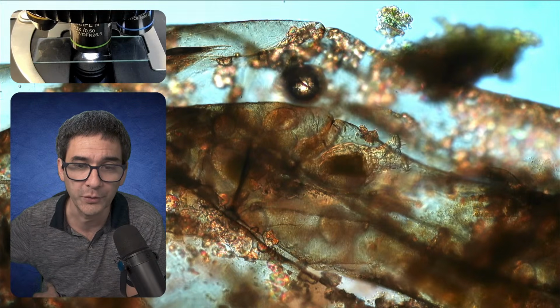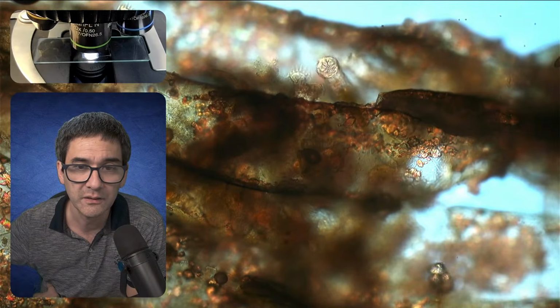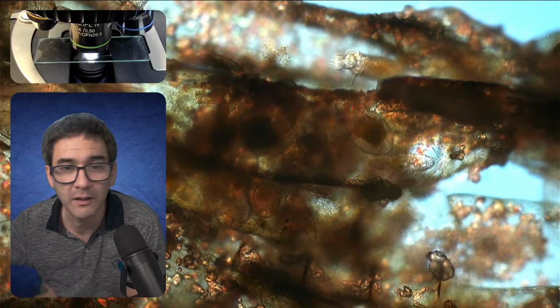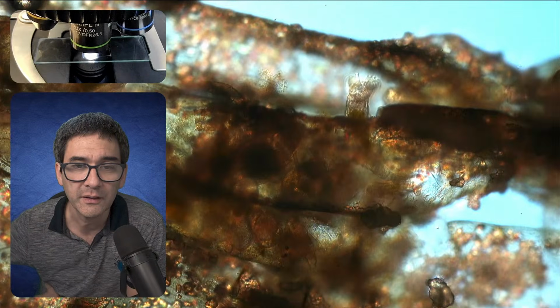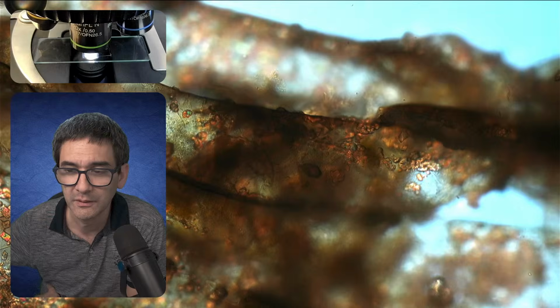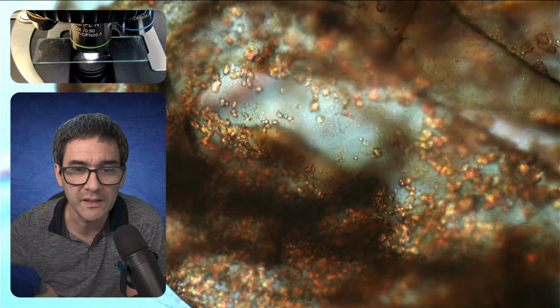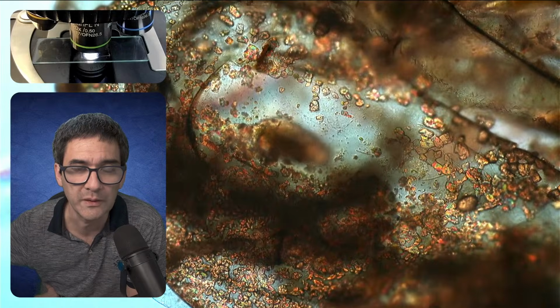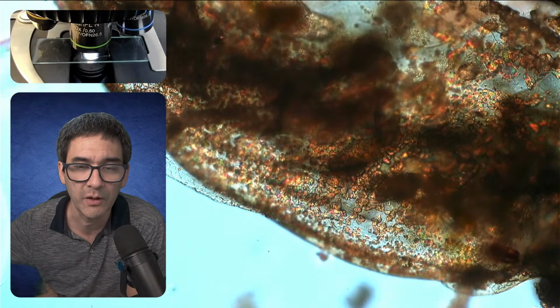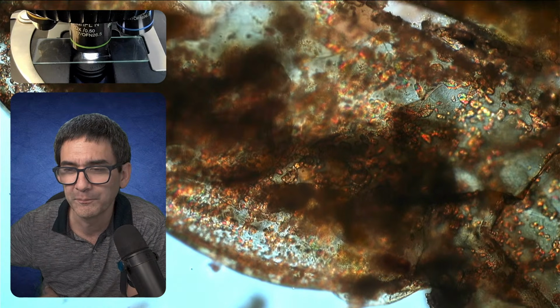There are a whole bunch of rotifers on this tiny piece. This is a huge paradise. Unfortunately, the decomposing moss covers up many of them. But that is something that we can see quite frequently. If you want to see sessile organisms, you have to, of course, put some solid material under the microscope.